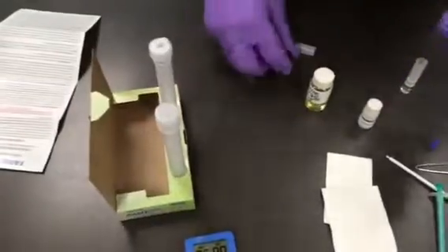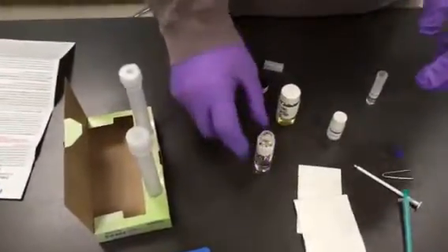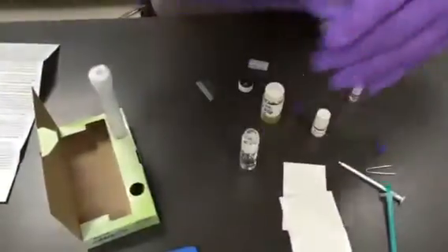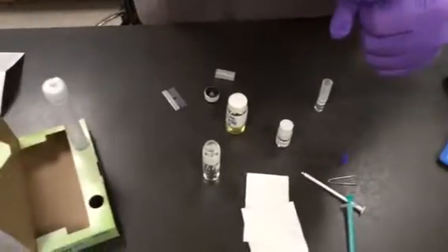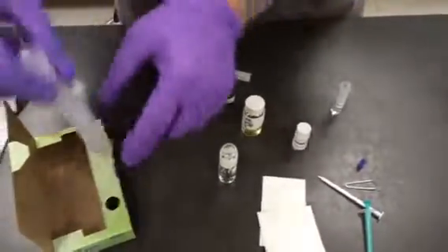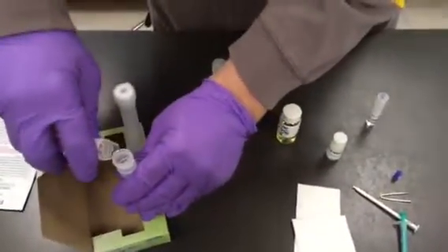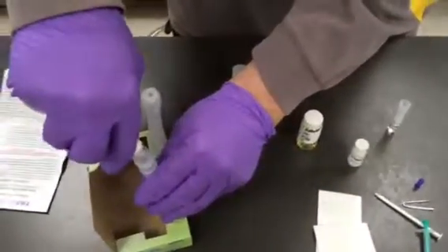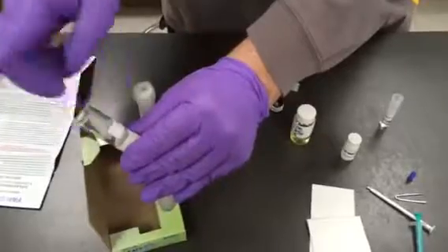We're just opening the vial of extraction buffer, and we're going to add that to our reaction tube first. As with everything else, making sure we get all of it in there.